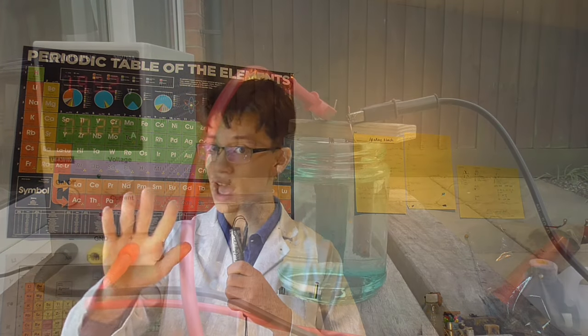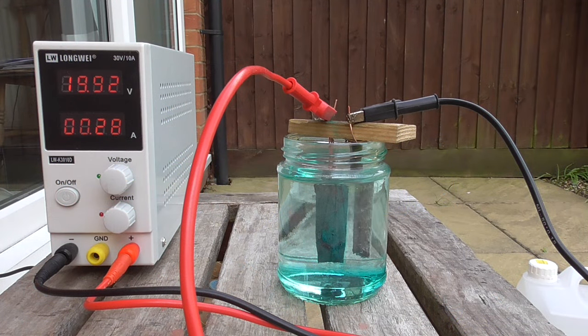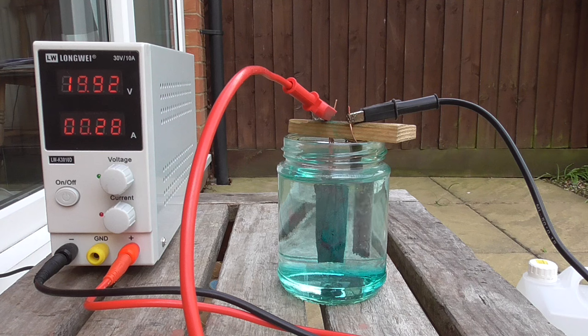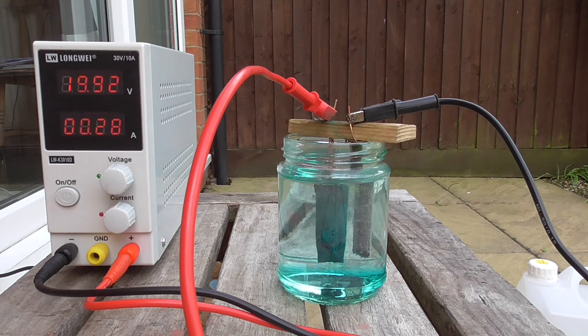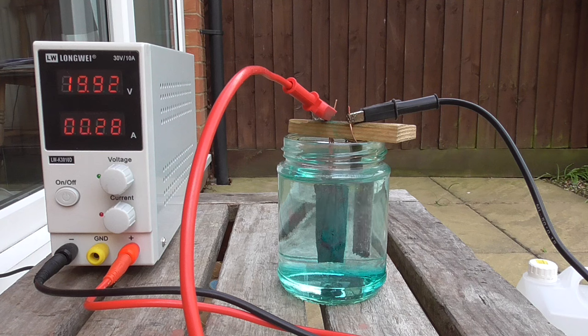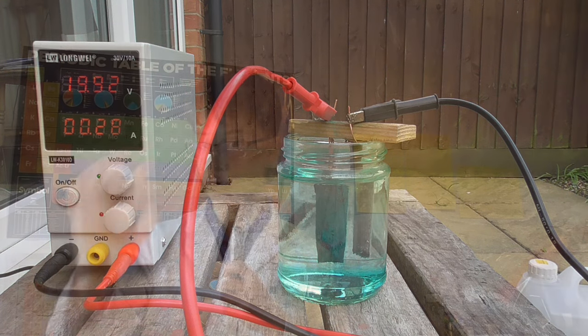Anyways, after 10 minutes of doing electrolysis, there is — I swear — a slight blue-purple color to it. However, this camera is a piece of shit and it just has a rubbish color depth to it, so it just could not pick it up at all. But I swear the solution did turn purple — the camera's just showing it as clear.